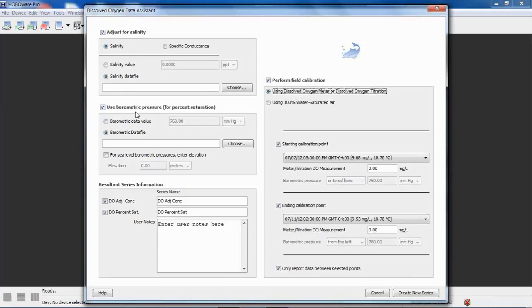Starting up in the left-hand corner, if this particular deployment was in salt water, you want to adjust for changes in salinity. This particular deployment was actually in salt water. You have two different ways to adjust for salinity based on either a salinity measurement or a specific conductance measurement. If the salinity is not changing, or if the specific conductance is fairly consistent, you can use either one of these as a fixed value. Salinity, again, is in parts per thousand, or what they call PSUs, practical salinity units. Specific conductance can be in either microsiemens per centimeter or millisiemens per centimeter.